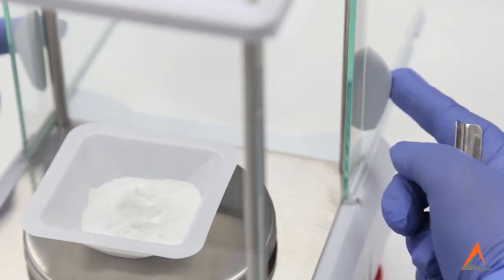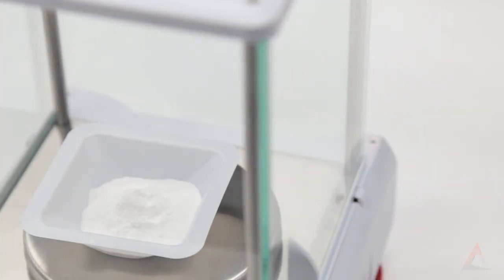Once you have added your powder, always remember to fully close your draft shield. Step away from the balance and let the weight reading stabilize to get an accurate read on your balance.